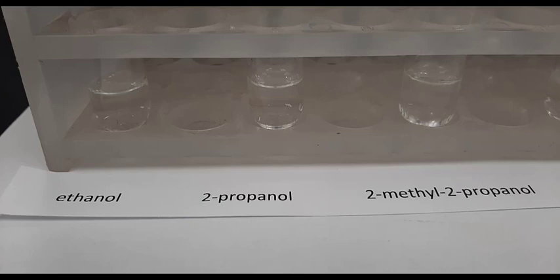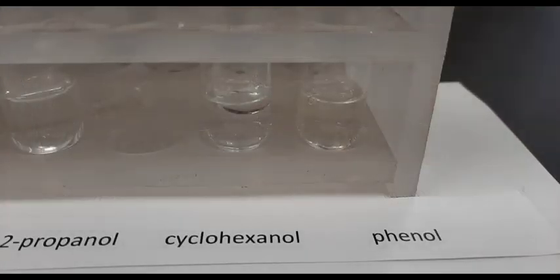Now we look at the solubility tests for those alcohols. The first three alcohols there - ethanol, 2-propanol, 2-methyl-2-propanol - they look totally clear. I don't really see any layer. And for one of these, you should definitely notice something different. It shouldn't be too surprising considering the number of carbons that that alcohol has.